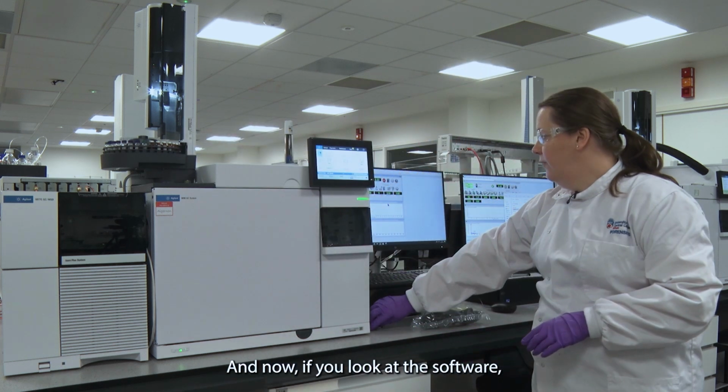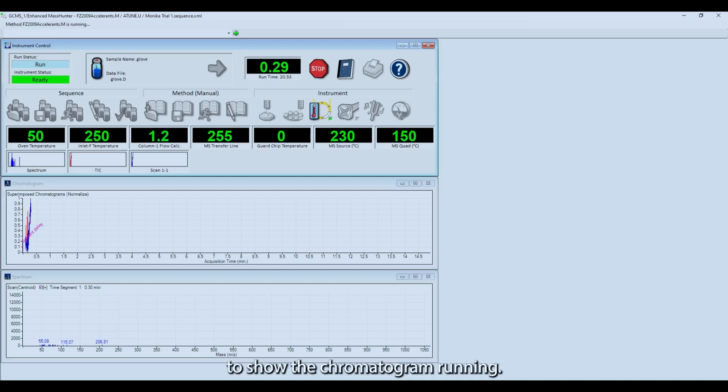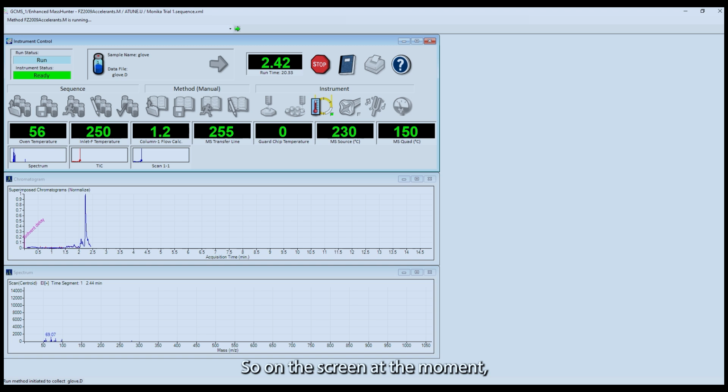Now if you look at the software, you can see that it's starting to show the chromatogram running. In a few minutes you'll start to see more of your peaks. On the screen at the moment you can see your peaks have started to form, and this is going to run for about 20 minutes.